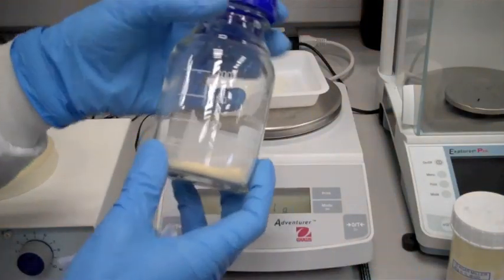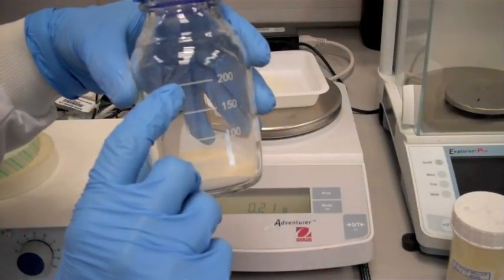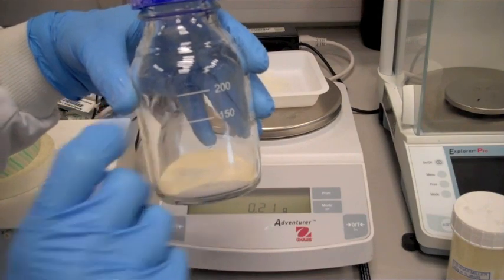Then add distilled water until it fills to the 200 milliliter line. And I'll show you how to do that in a moment.